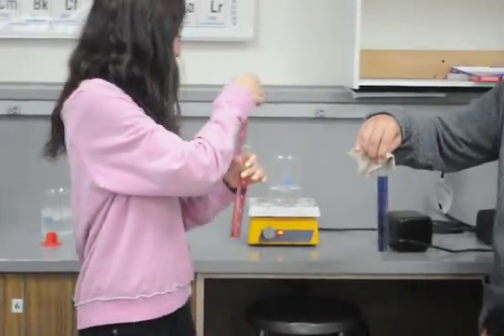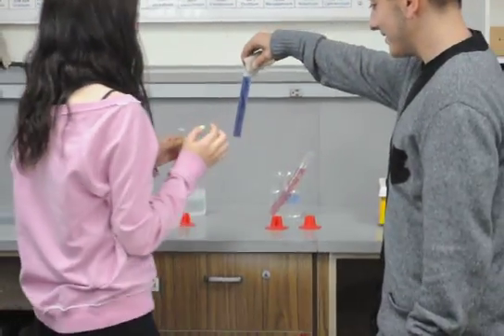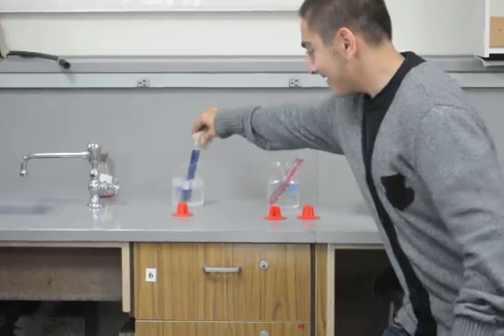And the one that's at room temperature goes right back where he was. Okay, go ahead. That's right. Now, yours goes in the ice, and Chate is going to go in the hot water bath.